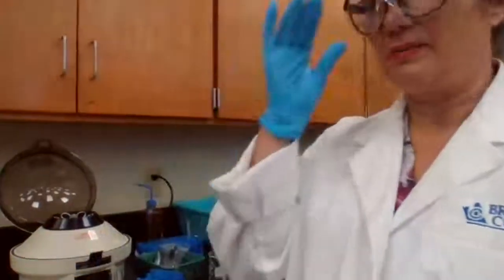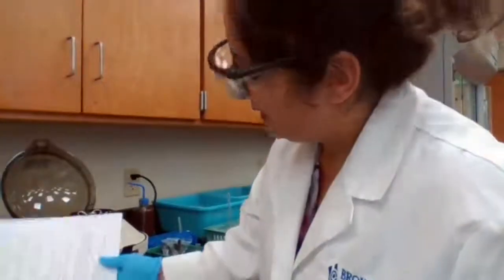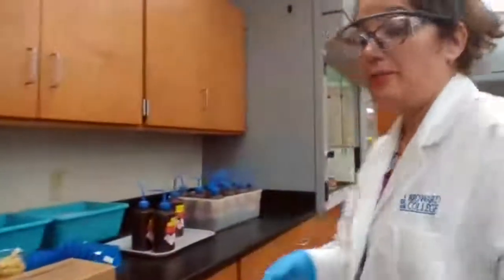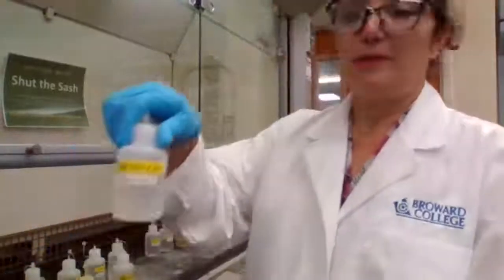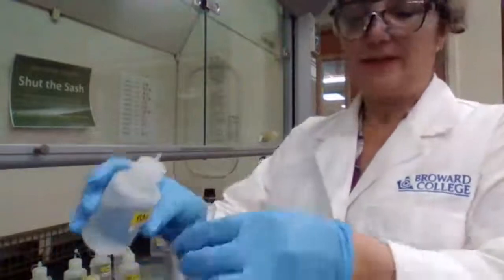So we are adding 6 molar NH3. What is NH3? NH3 is ammonia, and we all know that ammonia is a gas. So when we say 6 molar ammonia, that means it's ammonia in water. And ammonia in water, let me see how many drops before I move, 10 drops. Ammonia in water is ammonium hydroxide. So when you say 6 molar ammonia, that should actually be 6 molar ammonium hydroxide. So it's the same thing. So we're going to add 10 drops.